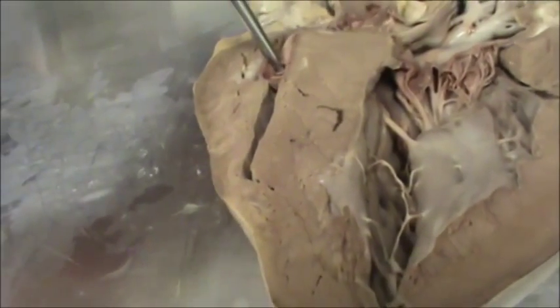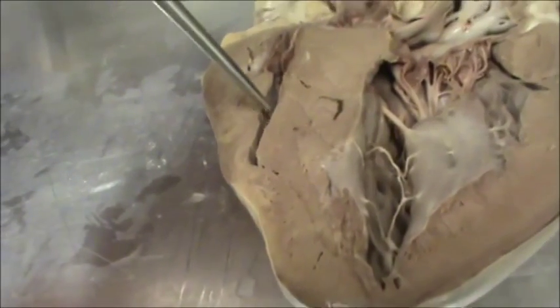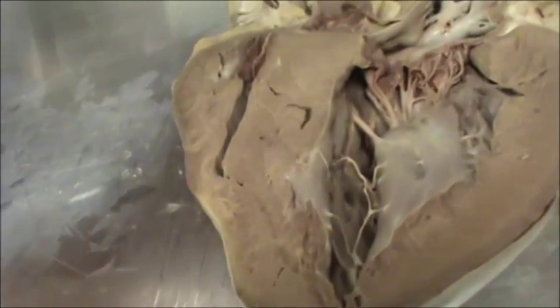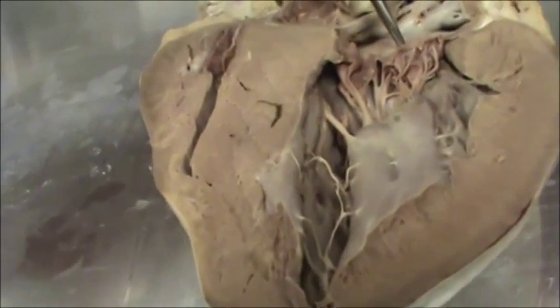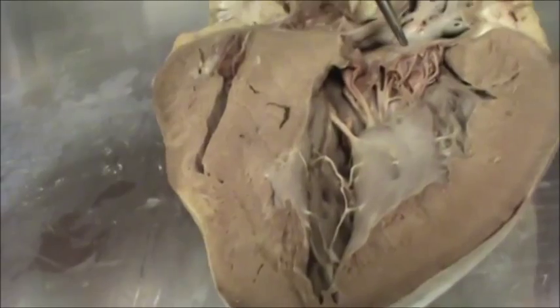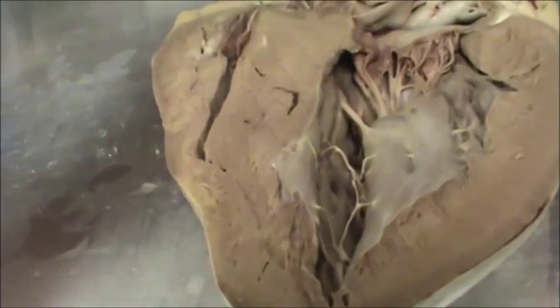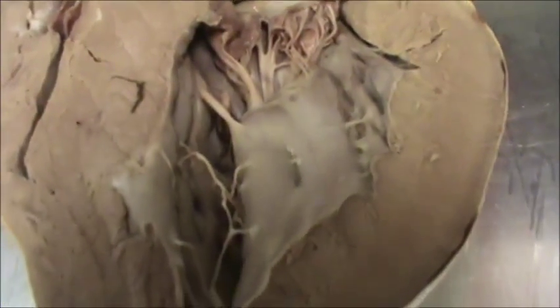The superior vena cava brings deoxygenated blood to the right atrium. Through the tricuspid valve it reaches the right ventricle, then through the pulmonary valve it reaches the pulmonary trunk and travels to the lungs where it gets oxygenated. Oxygenated blood then returns to the left atrium through the pulmonary vein, passes to the left ventricle via the bicuspid valve, and left ventricle contraction pumps the blood to the aorta through the aortic valve. That is how it works.